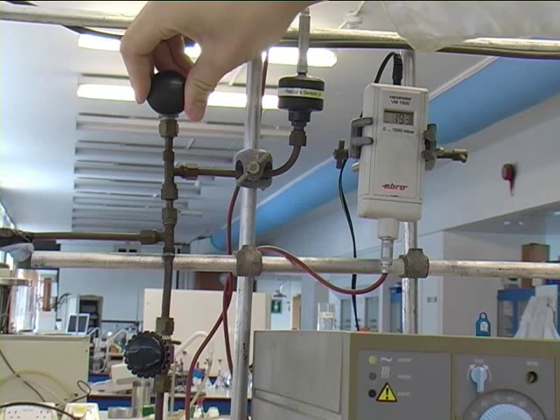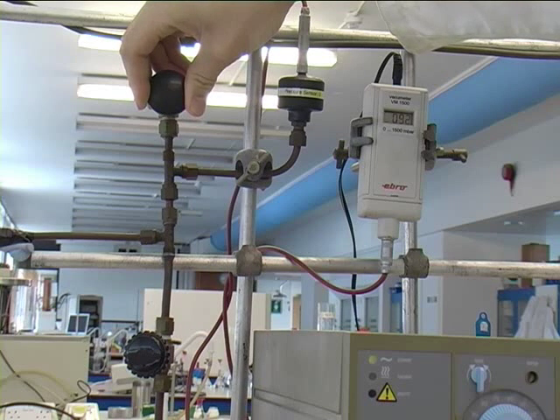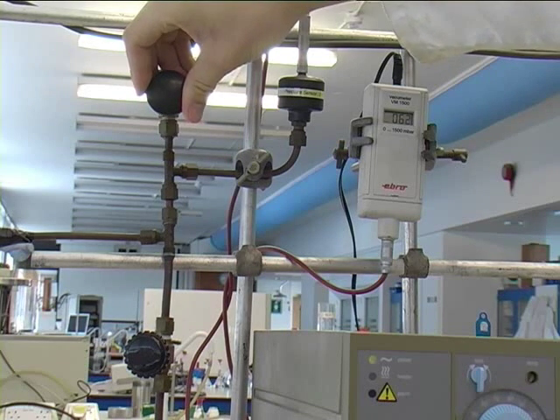The two valves will be used during the practical to control the pressure in the system and to balance the levels in the capillary and the boiling tube.